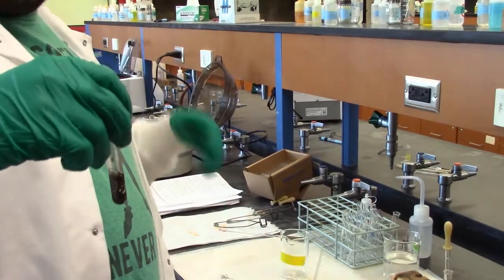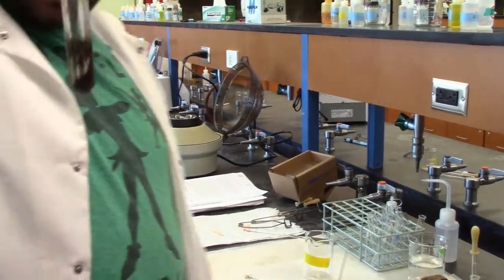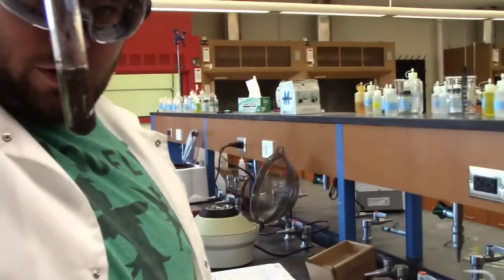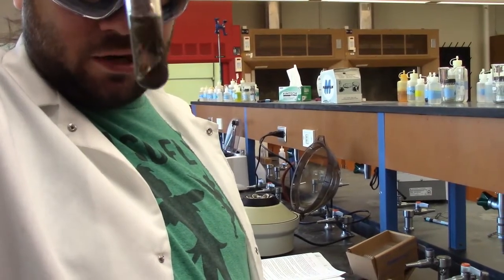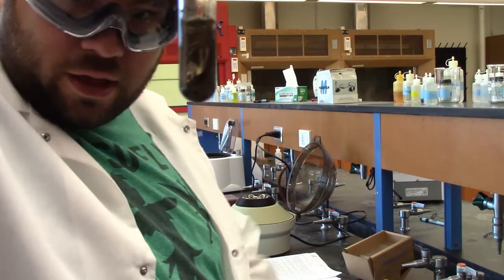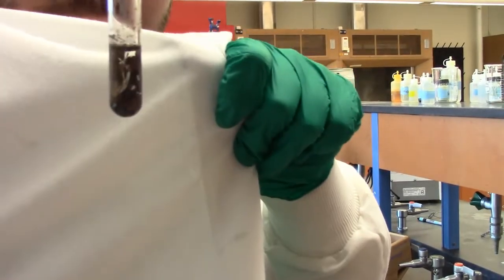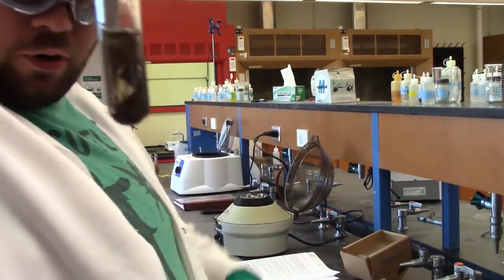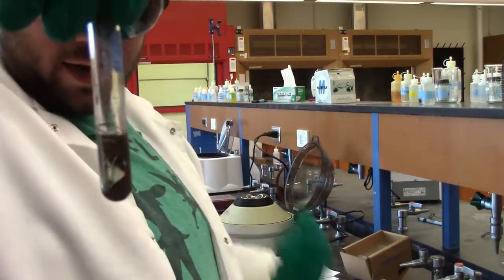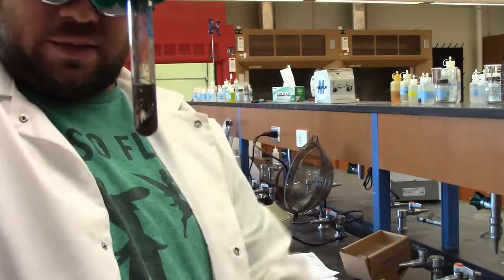Alright, so we did all those steps, we heated it, added the extra drop of ammonia and centrifuged some more, and now we've got this bad boy right here. And we've got a whole bunch on the side. That's the precipitate that we got out with the centrifuge. And if you look closely through that, and I'll hold my shirt up to see if that makes it better. Yep. You can see that the solution is now completely colorless. So we got rid of all that leftover yellow murky color and got all of our sulfides out. And all of our group 2 stuff is in this precipitate on the bottom.